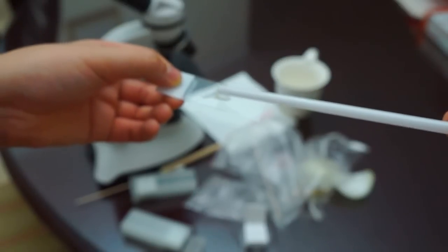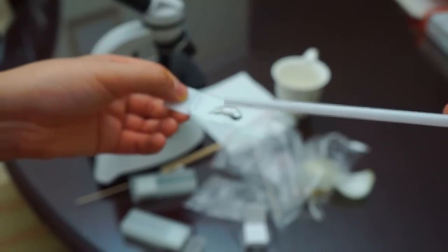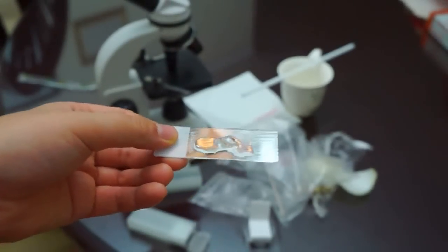We're just going to put some water. Don't worry if you put too much, you can just use a towel and clean it up later. The dropper is more efficient and easier.